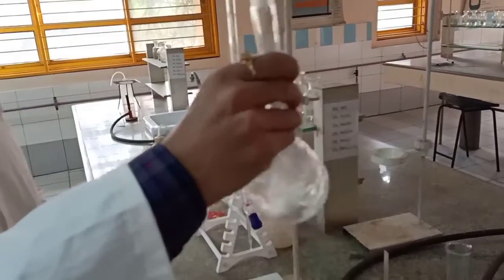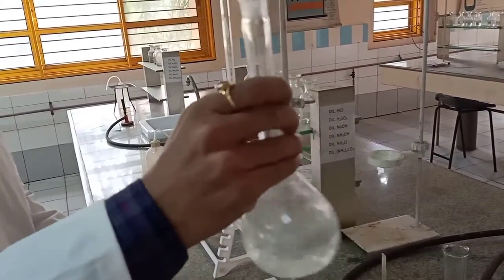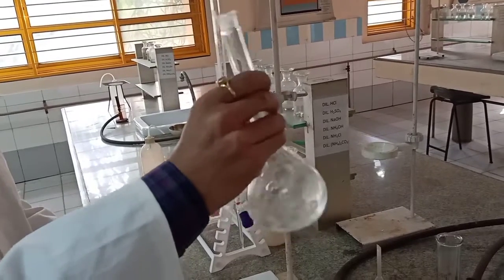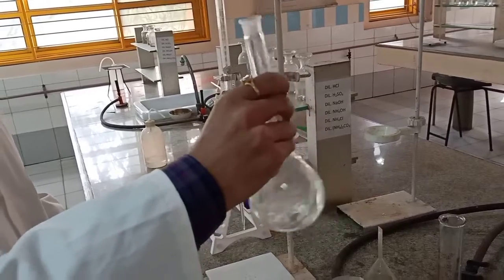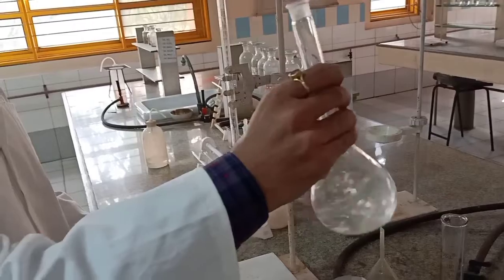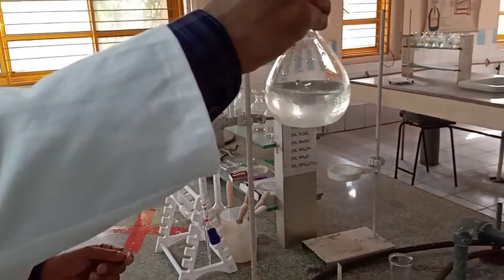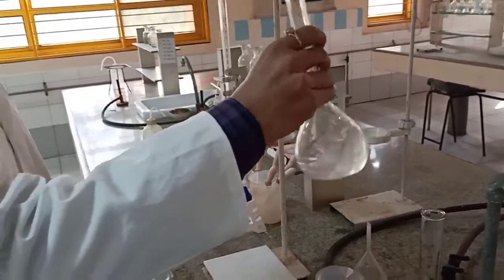To ensure that all the particles dissolve perfectly. Preparation of solution is known to you, so that's not difficult. But the only one thing which is a change here in this titration is that we have added a test tube full of 4N H2SO4 to prevent hydrolysis of iron. Okay, so this should be the solution.